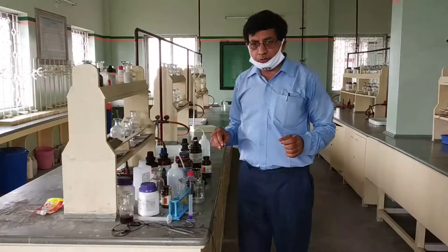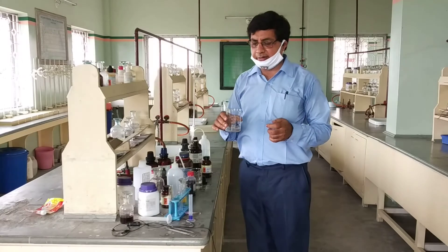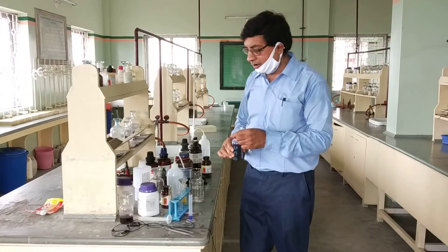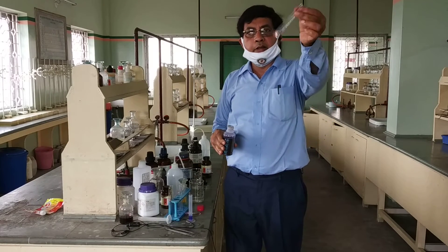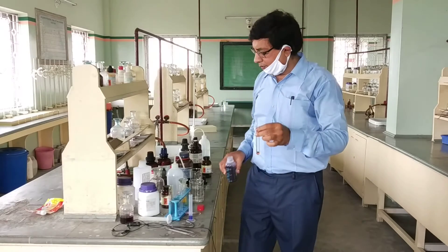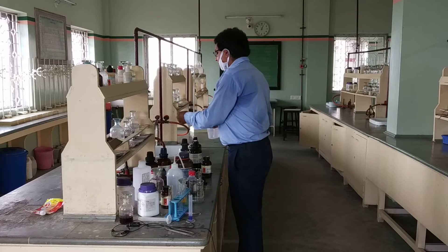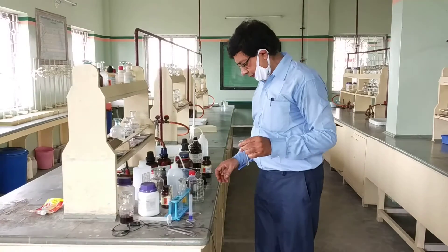The last functional group test for organic compounds is the carboxylic acid test, for the COOH group. We take a sample of vinegar, that is acetic acid — you know it has a vinegar-like smell. Take a small amount in a test tube and add blue litmus solution. What do you observe? The blue litmus turns red. Since acetic acid is a very weak acid, it is not deep red. This confirms the presence of the acidic group in the sample.